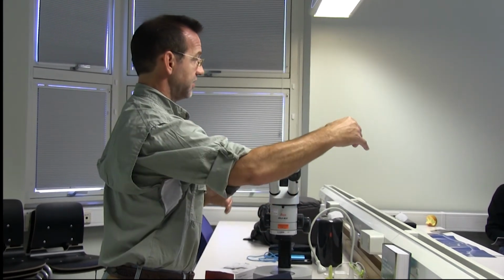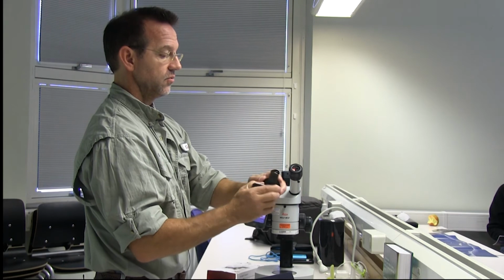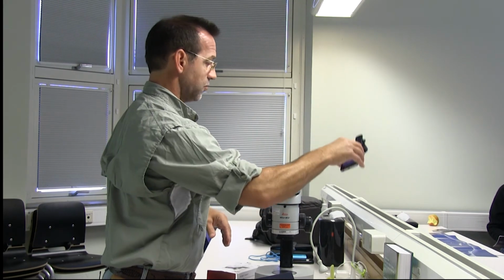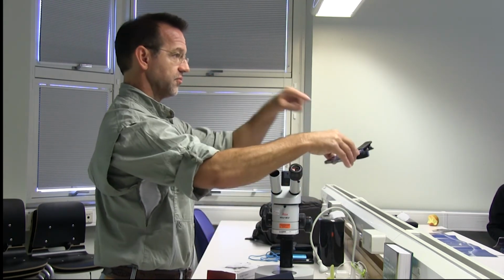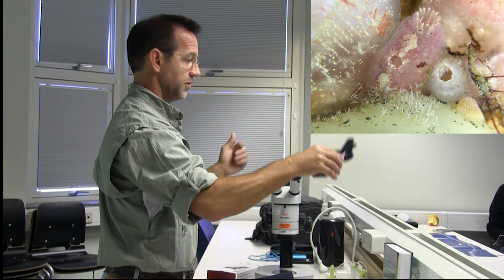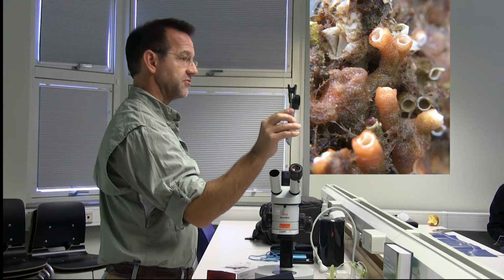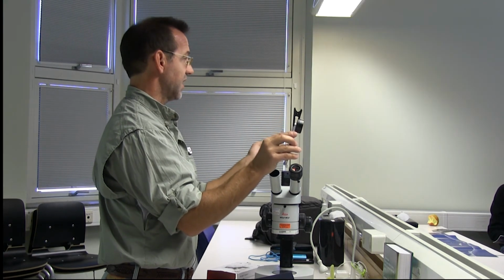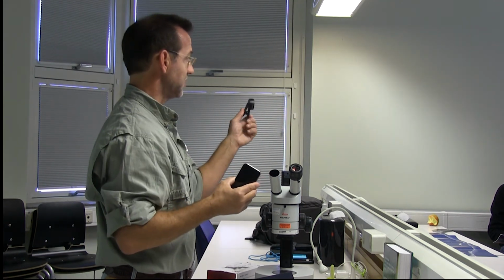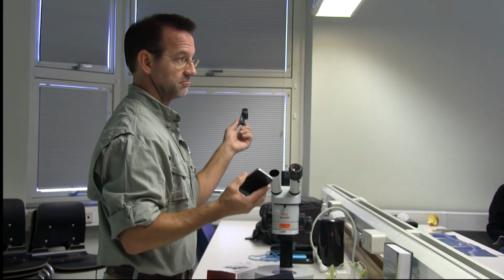So having the wide angle is nice for a picture of the whole disk, and then you easily take off the wide angle lens like that, and you have a macro lens, and then you can quickly get pictures of all different individual organisms that are easily seen with the naked eye. So quickly put it down right next to the sample, maybe within a few centimeters of the sample, and take photographs and video. So this is a really, really good tool, and it's the least expensive one out of all these other ones. So this might be 25 to 30 euros, like that.